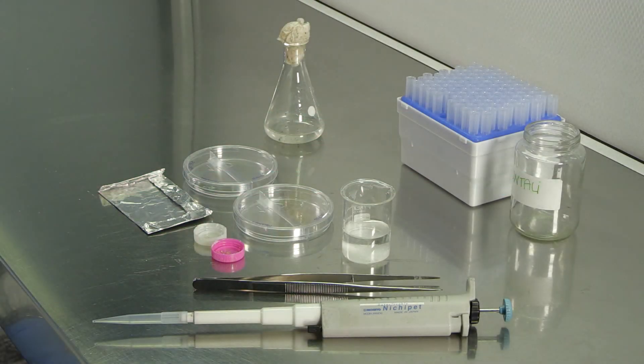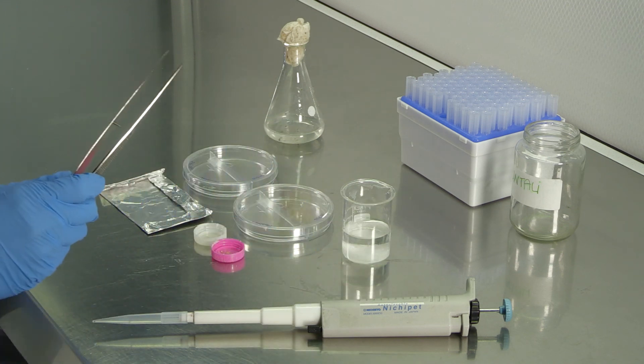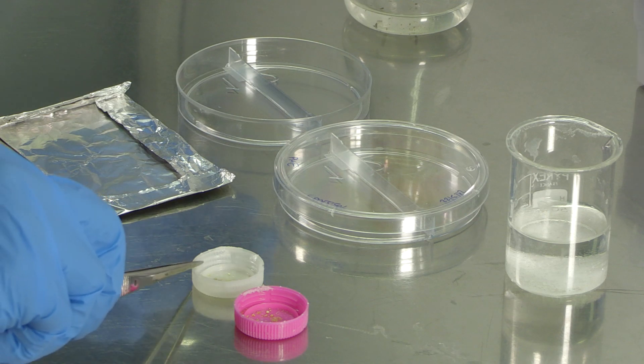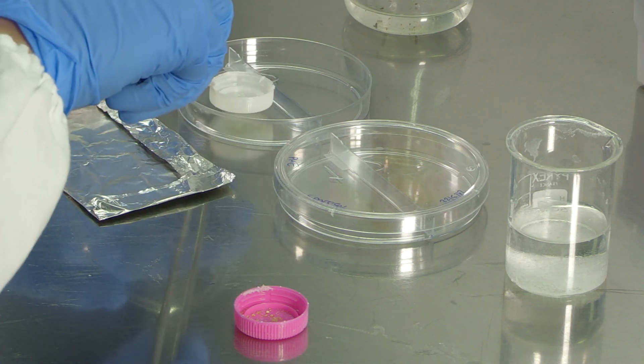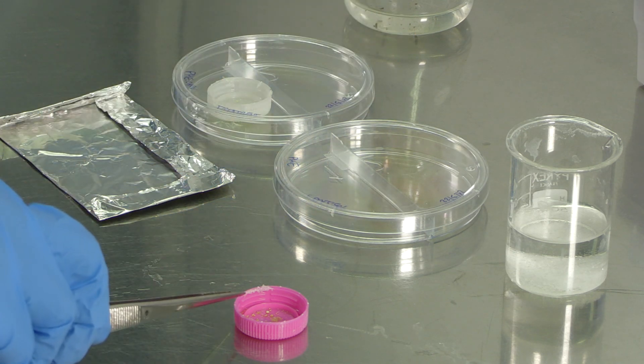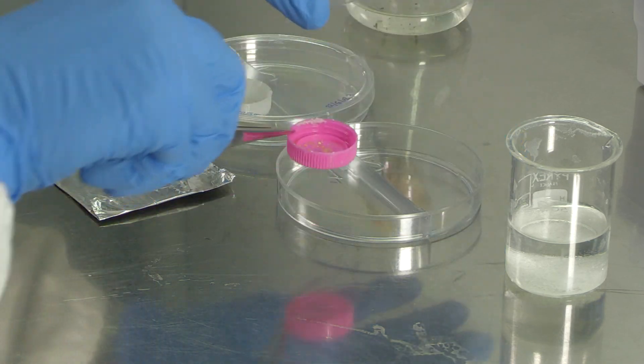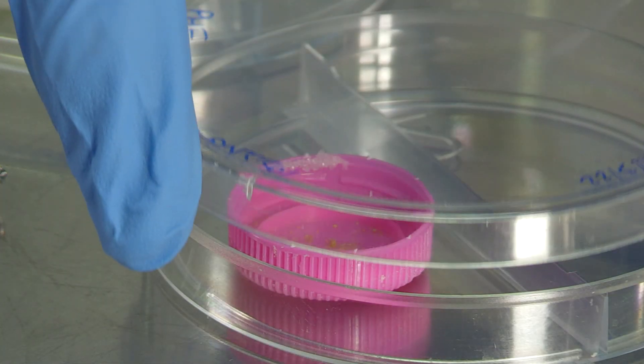These powdery formulations can be used to perform lab tests on different materials susceptible to fungal growth. The beta cyclodextrin essential oil complex is placed in the lower sector of a two-split petri as antifungal treatment. The same is done with free beta cyclodextrin as reference for the non-treated sample.